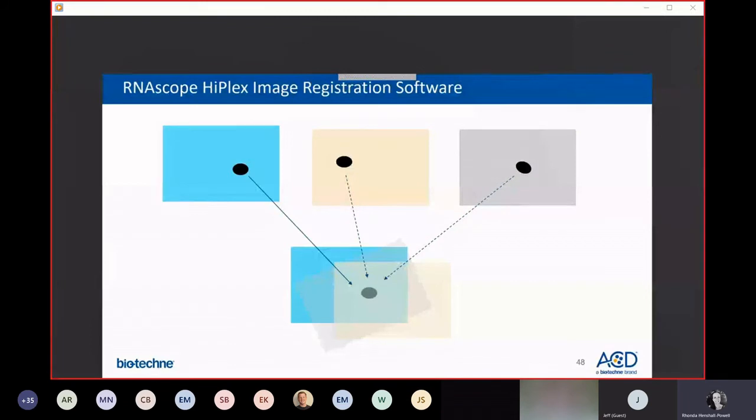So I'm going to conclude this discussion of the HiPlex assay by showing you how to use the image registration software to generate the beautiful images that I've been showing you. And basically what the software does is it uses the DAPI nuclei from the different rounds of imaging, and it overlays images onto one another based on the DAPI nuclei. Here's just a crude schematic of what that software does. So for instance, if we decide that the cyan image here is our reference image, the HiPlex registration software is going to transform these other two panels such that now the nuclei are overlaid on top of each other. The software can align images that are only 70% overlapping, although you really want the most overlap possible because non-overlapping edges outside of this Venn diagram will be cropped away.